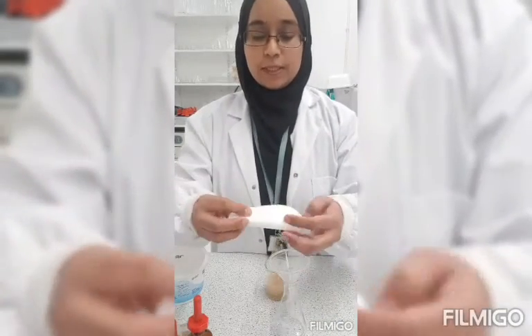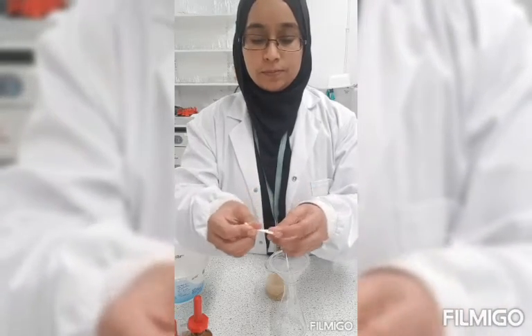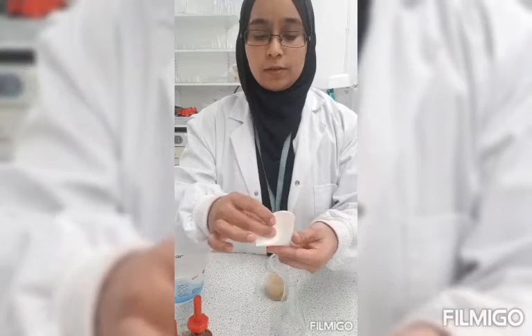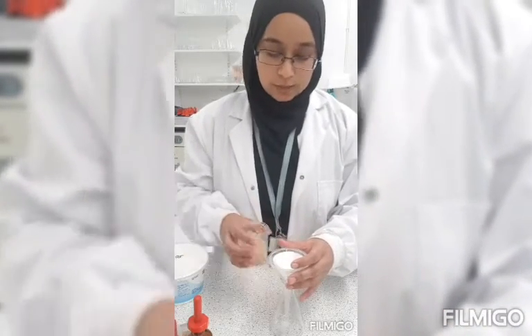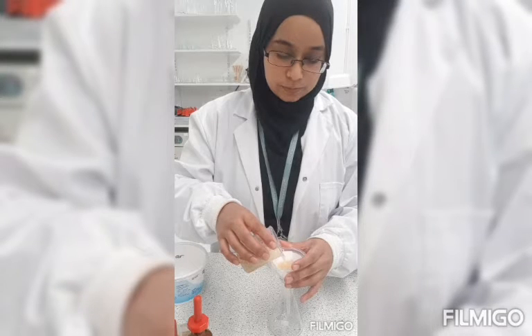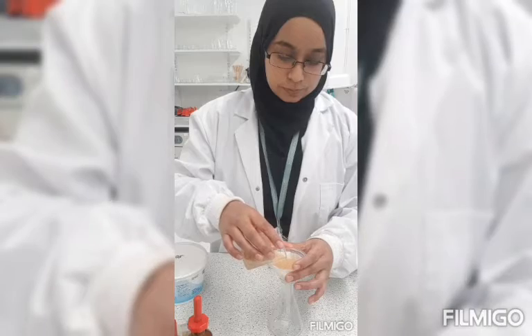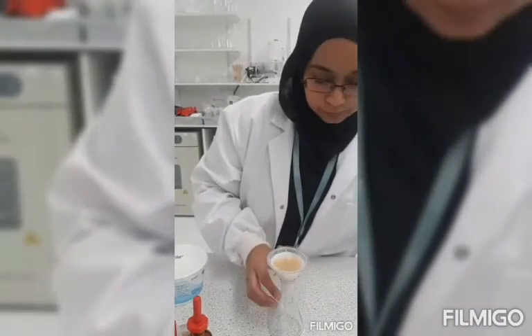The filter paper needs to be folded twice, with one side of the paper on one end and the other three on the other side. Put that into the funnel and then filter the biscuit solution through. Give it a few minutes to filter.